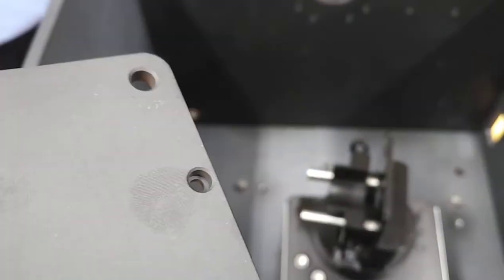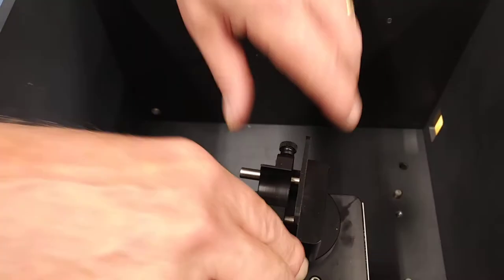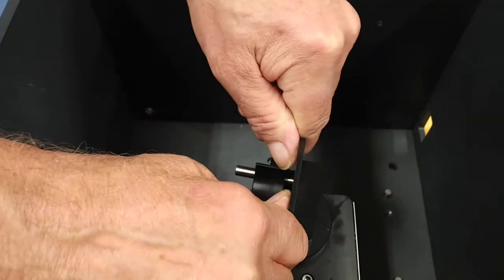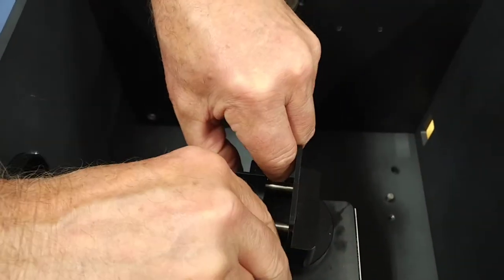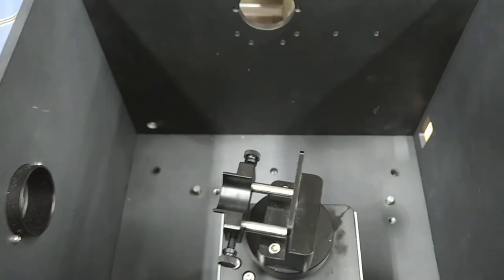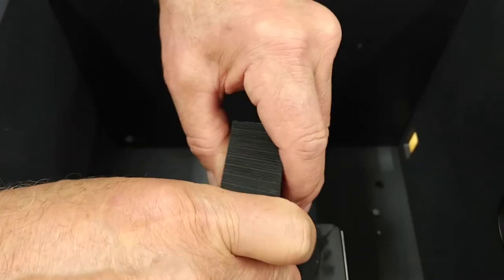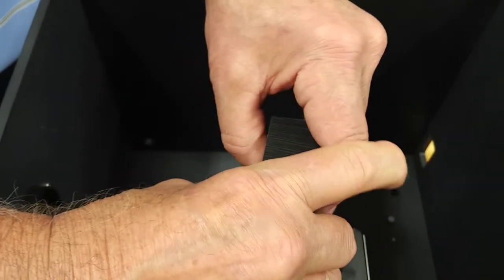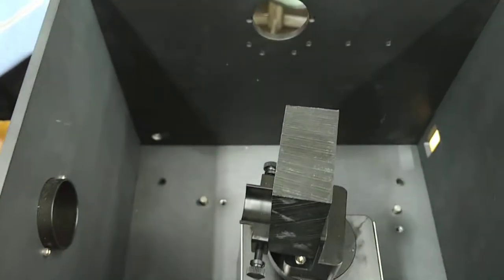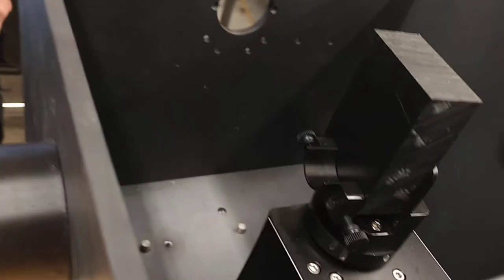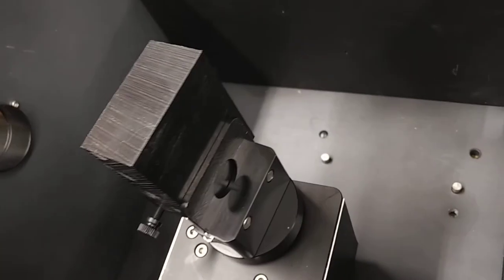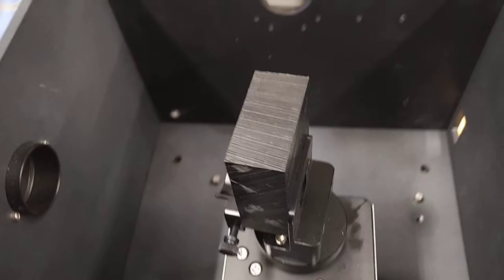And now we'll go to a considerably larger piece, necessitating the greater distance of the holding block. And now we have a piece about as large as we would go for this particular setup.